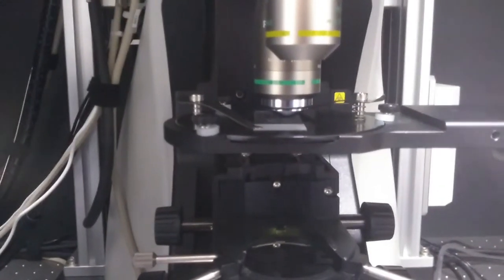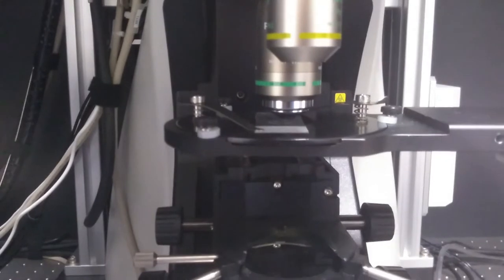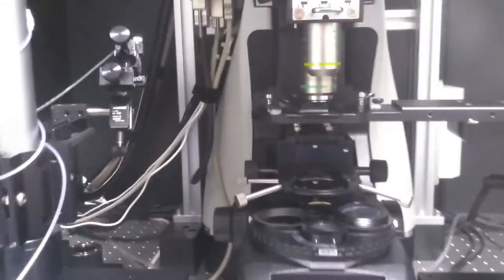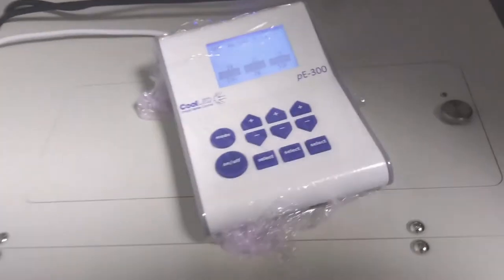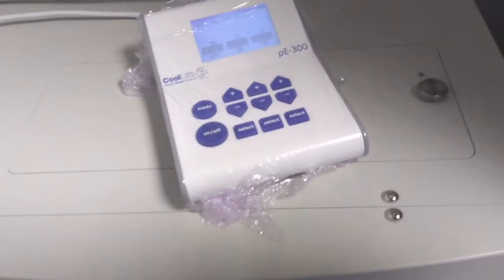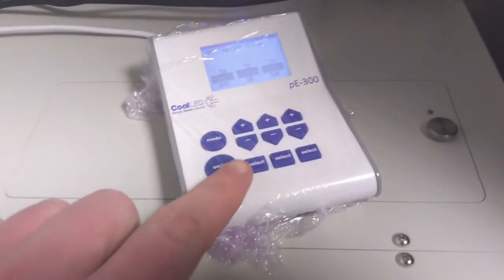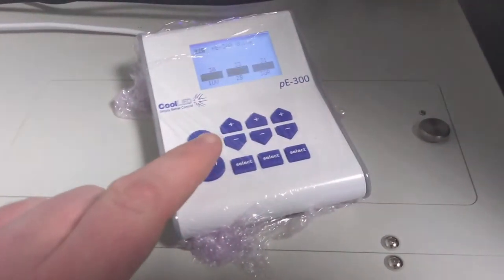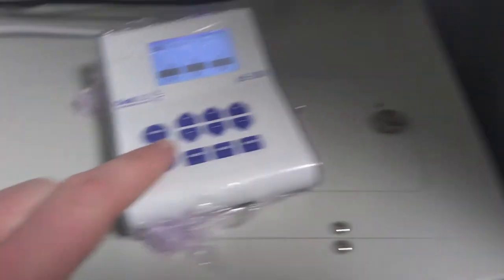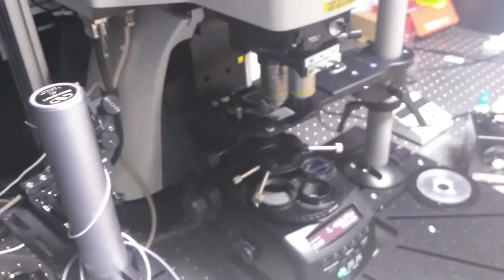You will then need to use some illumination to see your sample. The illumination controls for fluorescence can be found on top of the confocal tower. Usually all you need to use is the on button and you may see light coming out of the lens to then be able to focus with.